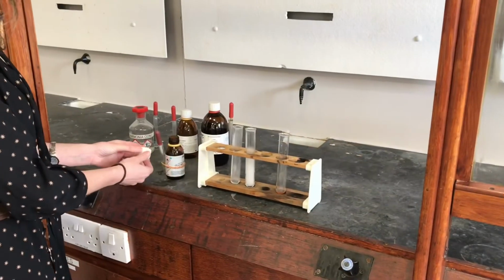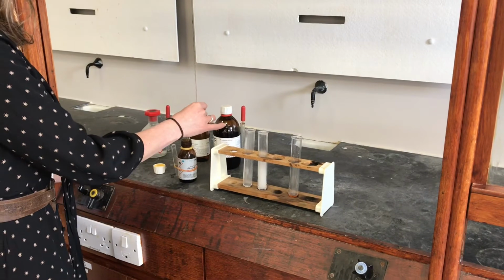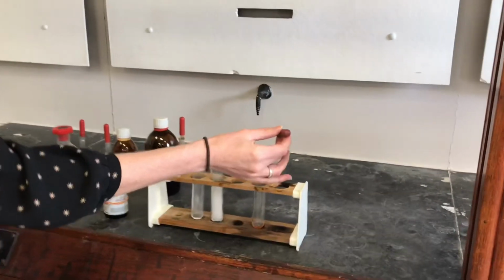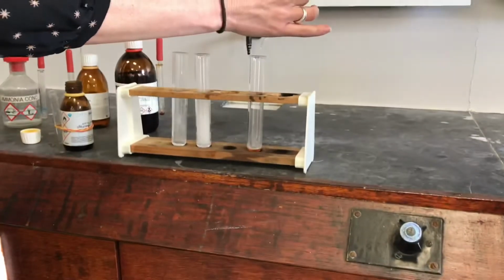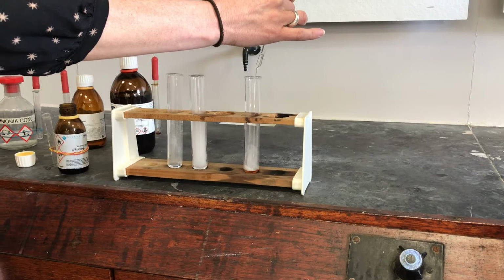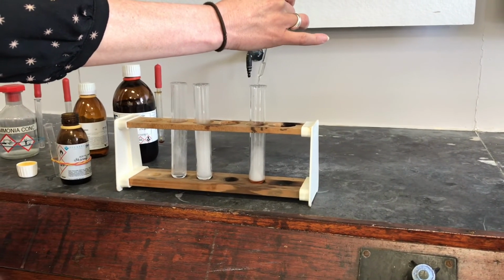We're ready to try the final amine this time. So this one is the aminobenzene, or phenylamine. Let's add a couple of drops of the ethanoyl chloride to this one. Okay. Now this one's actually, you can see, a slightly less vigorous reaction than we had in the previous one.